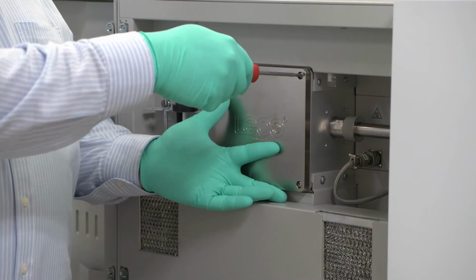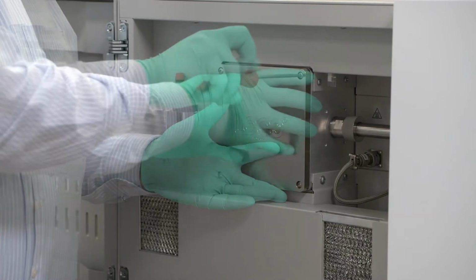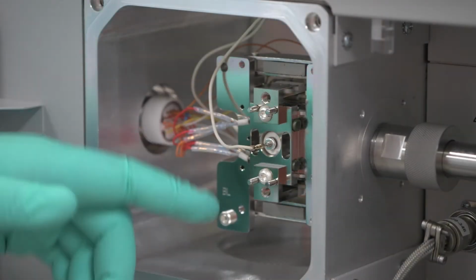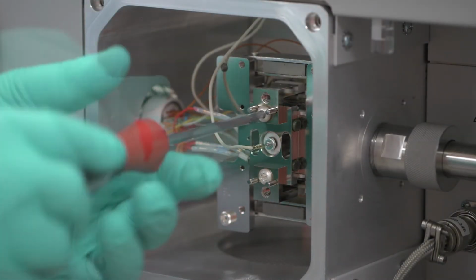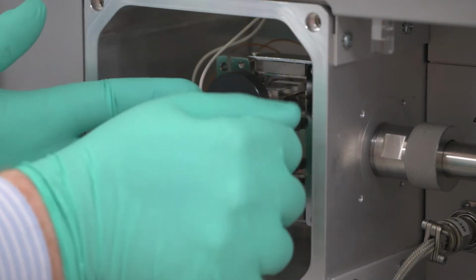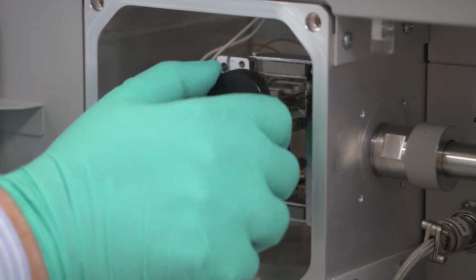To get started, remove the front plate and the four captive screws using the screwdriver provided. Next, remove a single screw on either the top or bottom filament. Using the special filament removal tool, grab and pull out the filament.